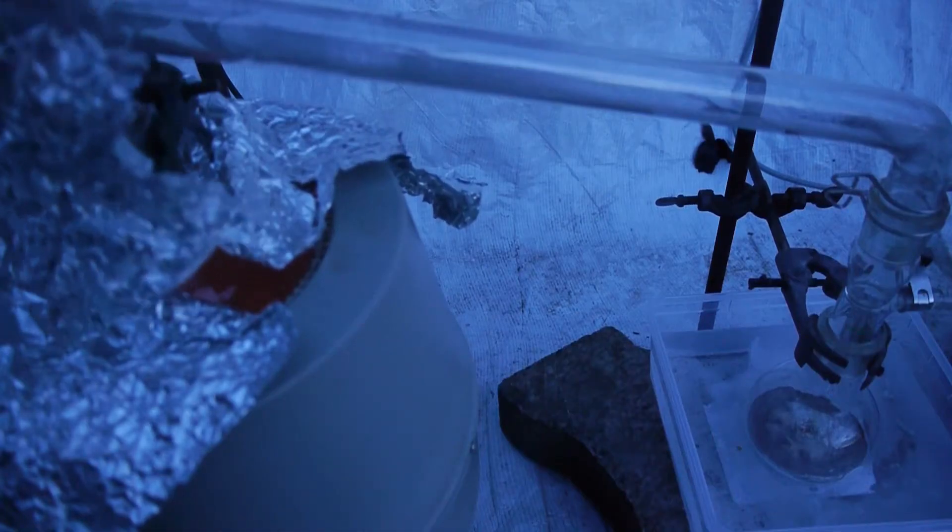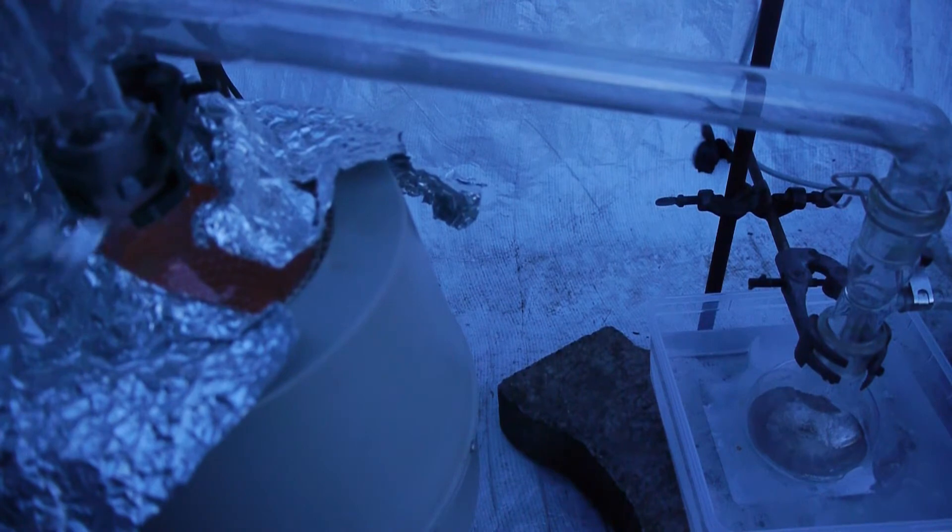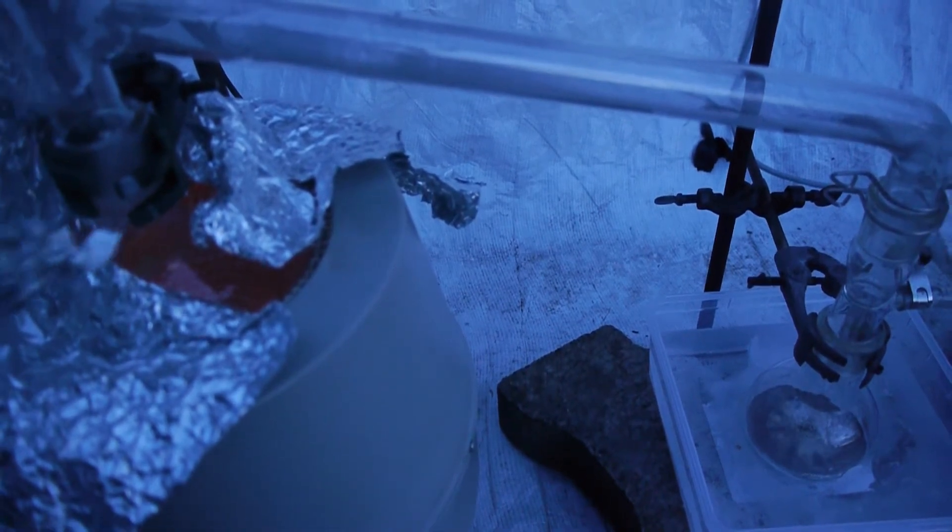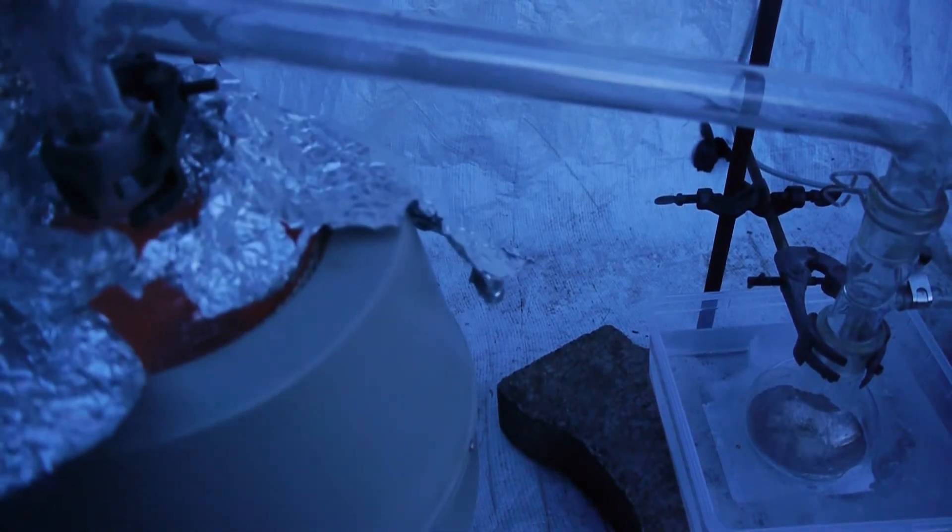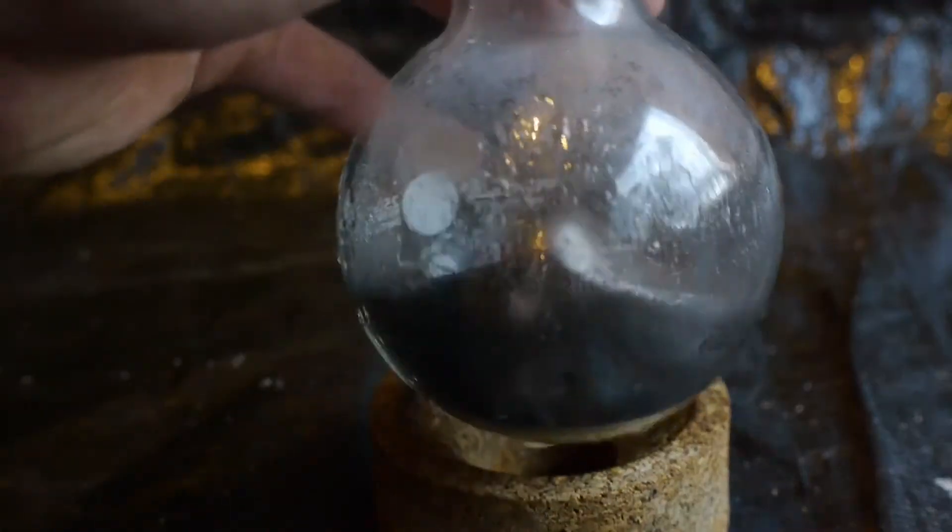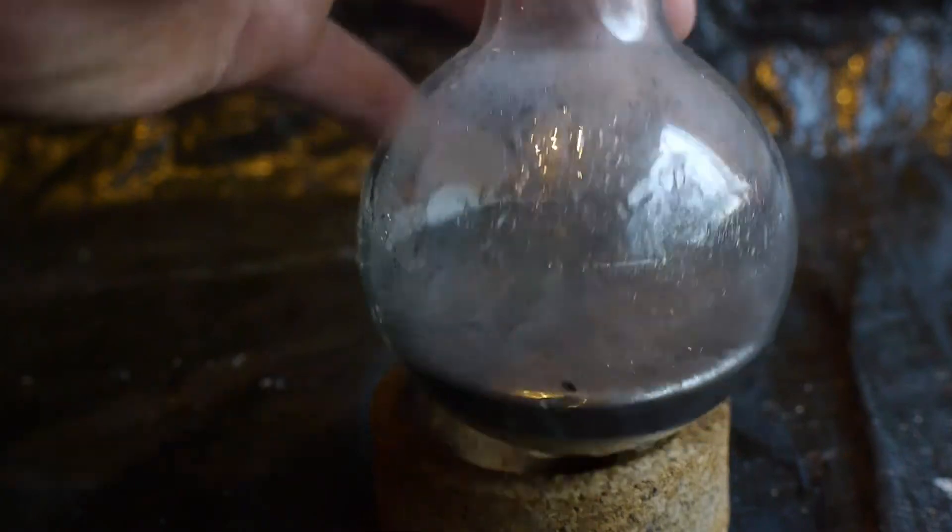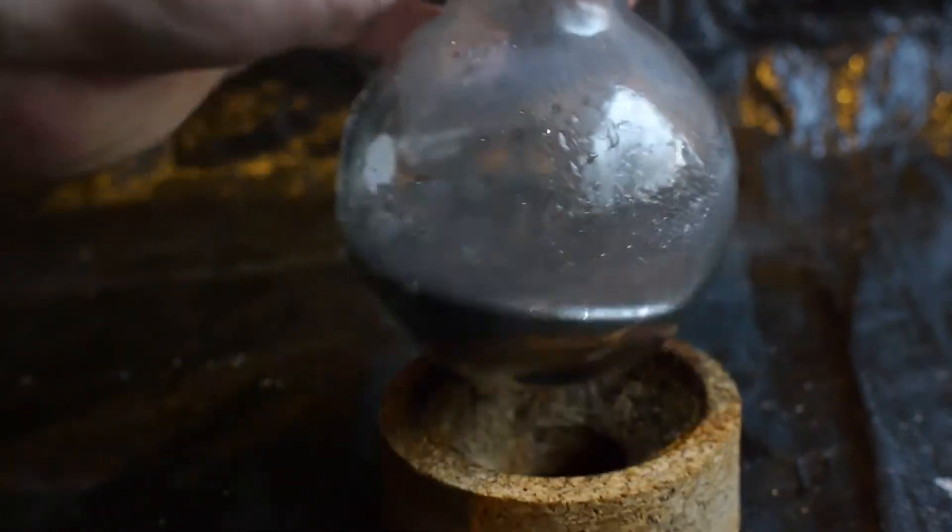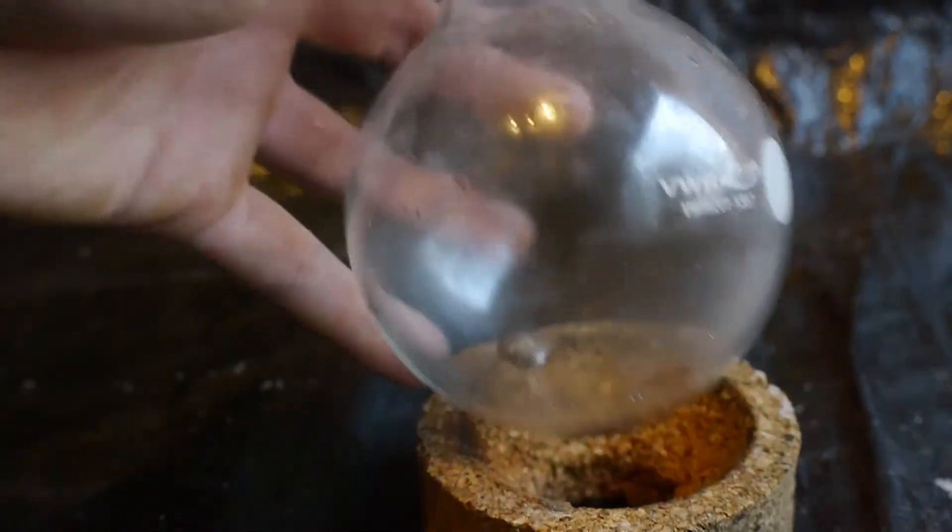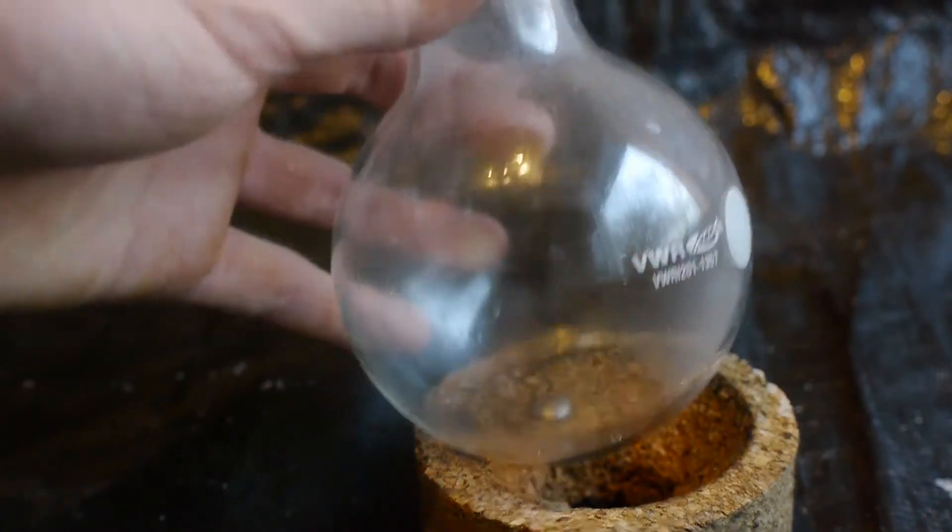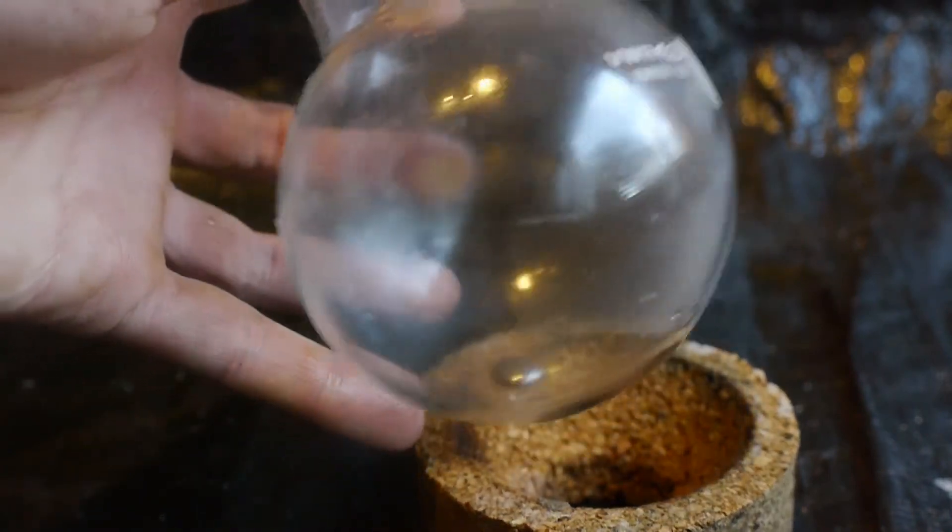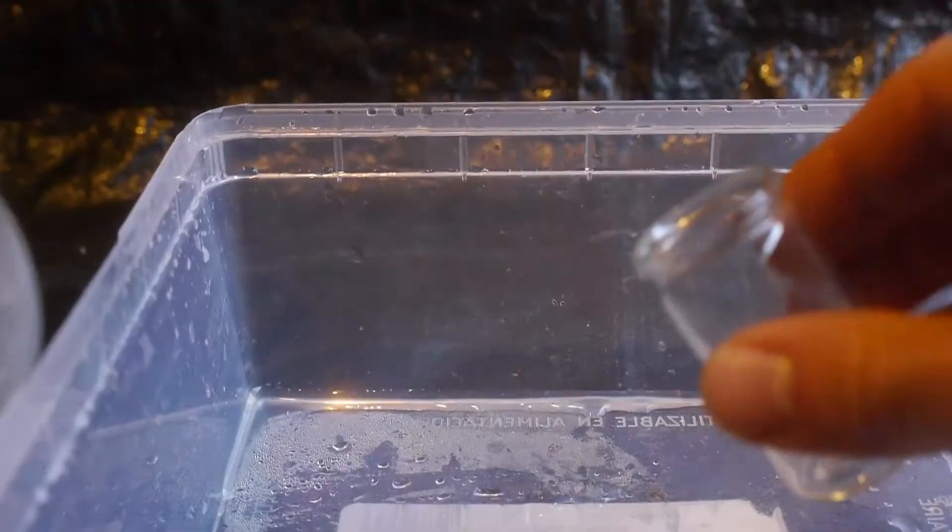Okay, the distillation is as far as I can get it I think. It's glowing red in there. And there is only a tiny droplet of mercury left. Here is the mercury after the distillation. As you can see it doesn't look exactly very clean. So I am probably going to have to repeat that. Here is what was left over from the distillation. So if there is any gold in the mercury, it must be in this bead. So I am going to fill this into a separate container.